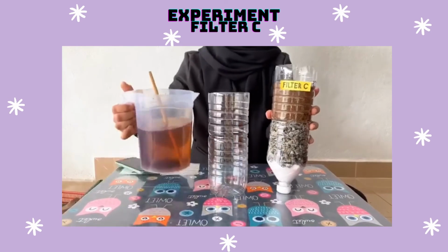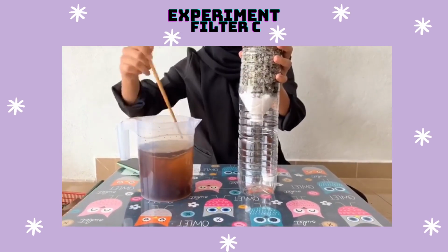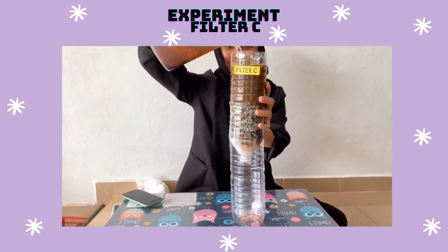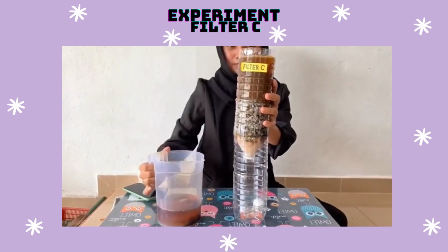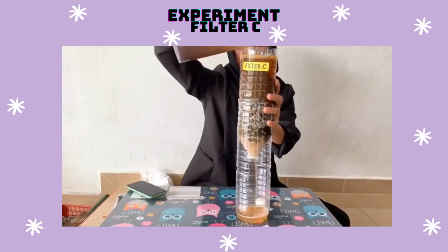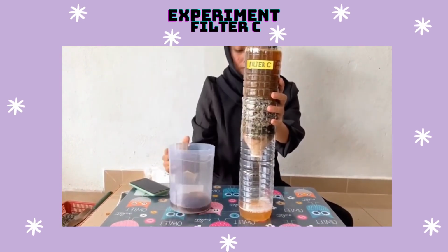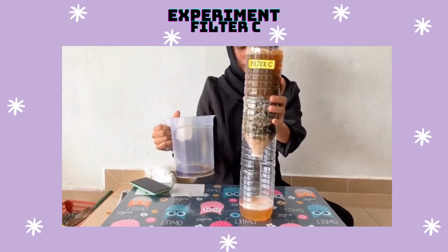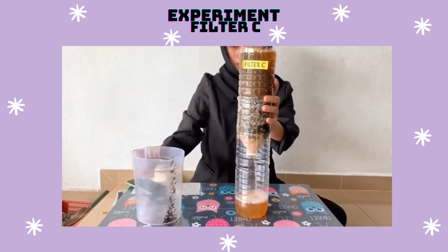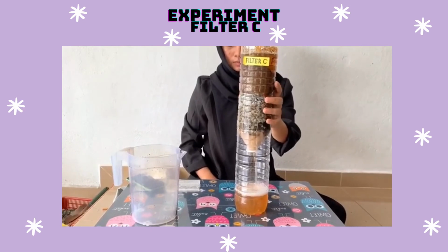For water filter testing, prepare a bottle under the water filter. Pour the synthetic water into the filter bottle. Then wait until all the synthetic water goes into the bottle.